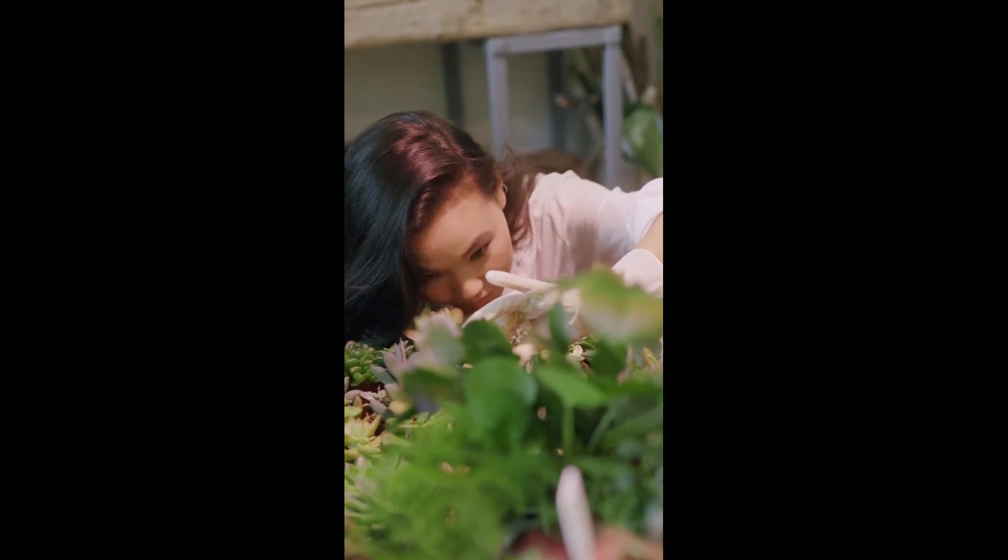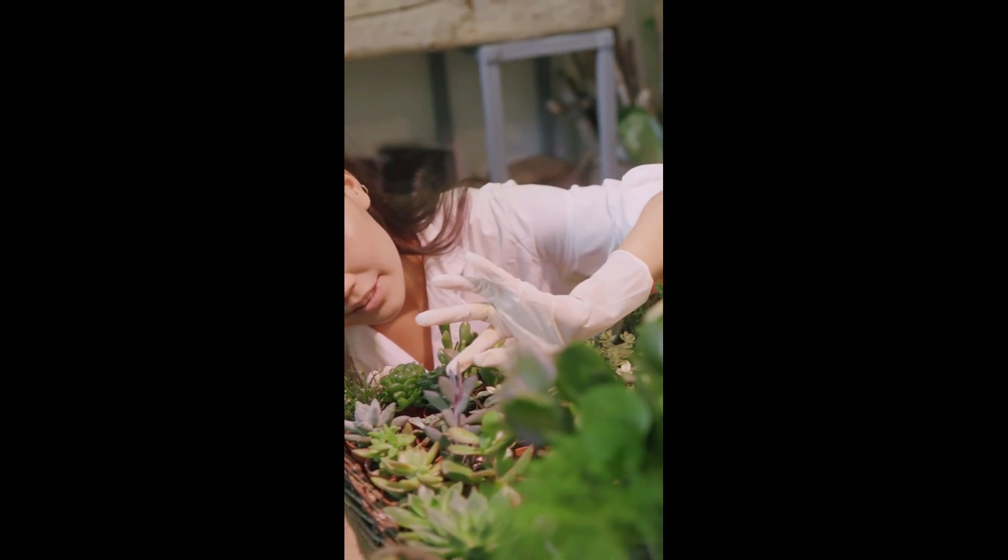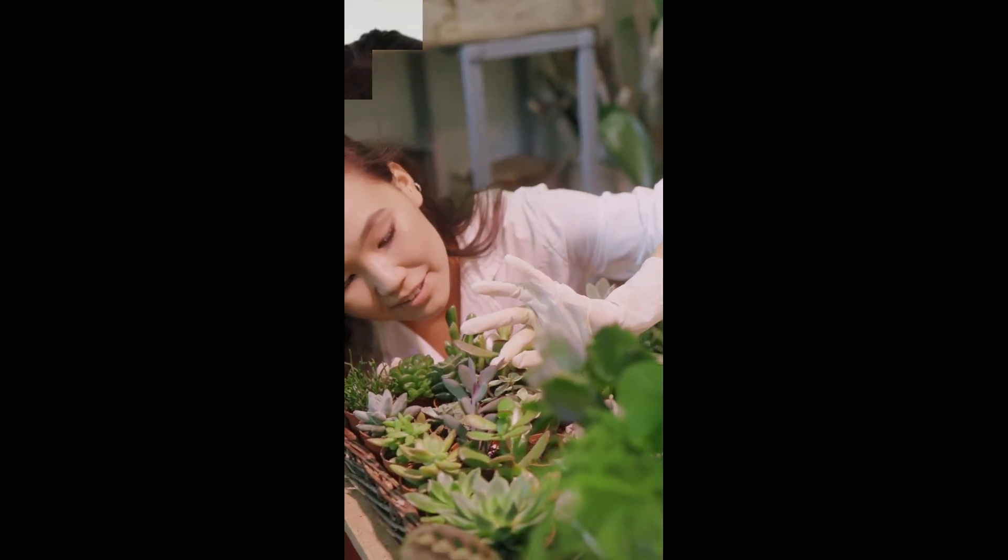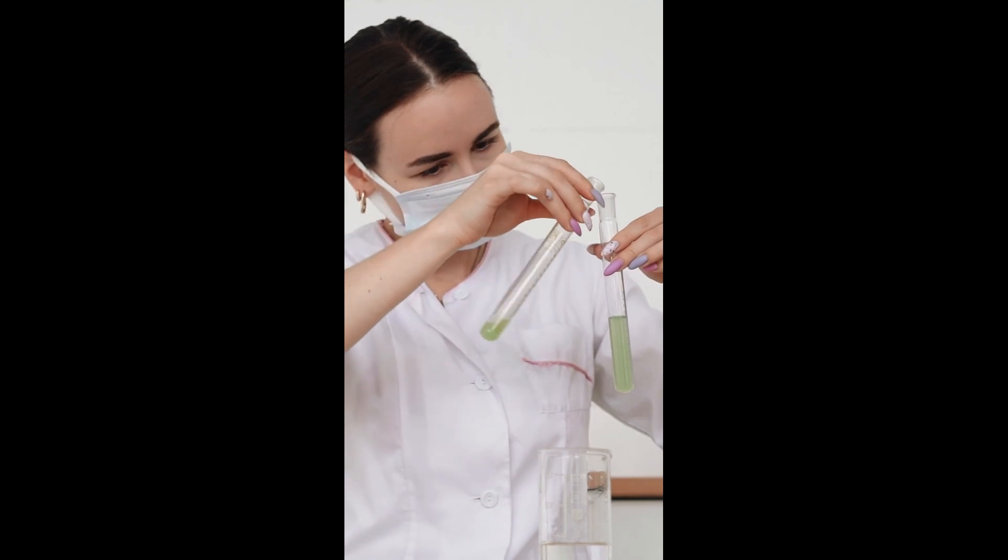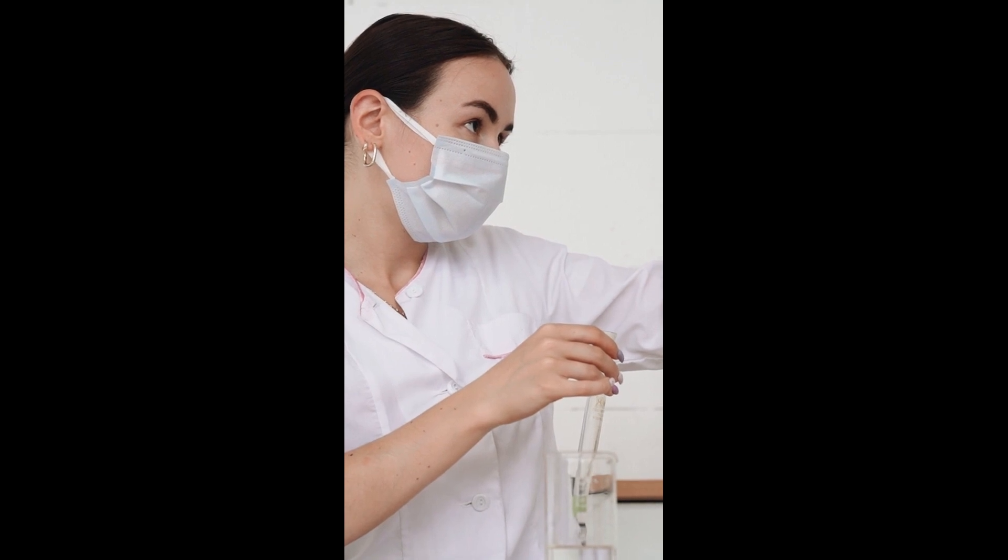Green synthesis of zinc oxide nanoparticles using neem extract. We want to synthesize zinc oxide nanoparticles in a simple, eco-friendly way. In this video, we will show you how to make zinc oxide nanoparticles using neem leaves, so stay tuned with us.